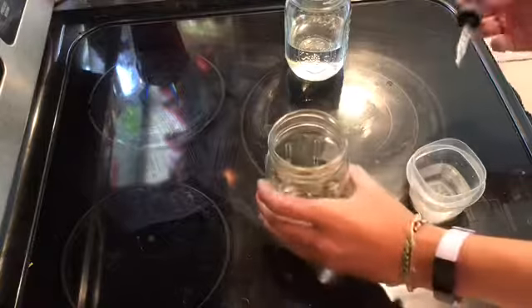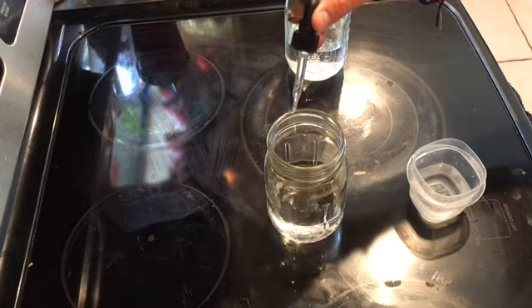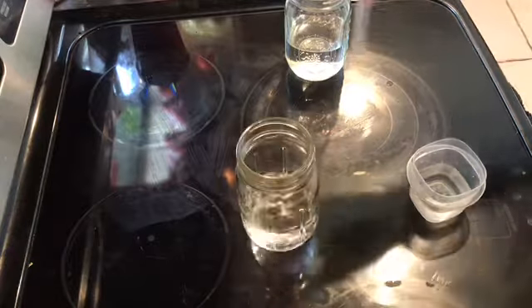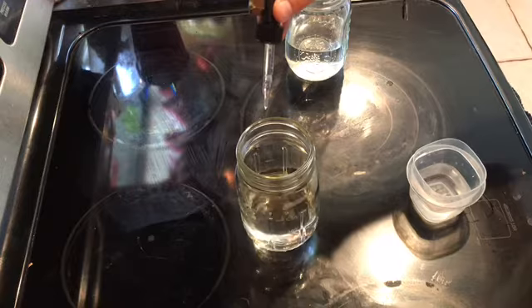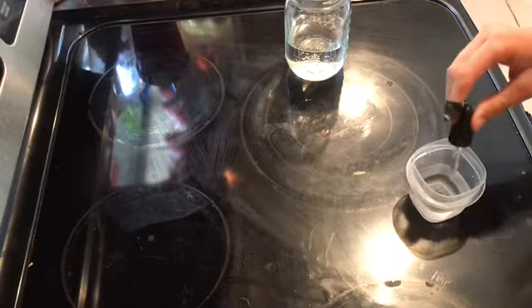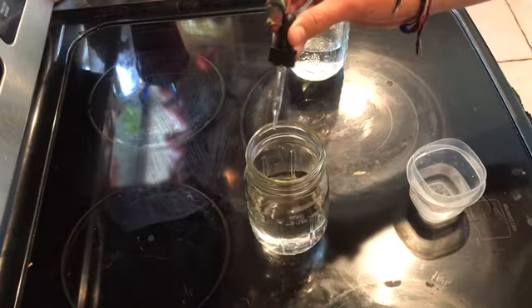The initial pH of the water was 7, and then there was a drastic increase in the pH after adding 10 drops of NaOH, and it reached up to 12.70, and then after 20 drops it was 12.50, after 30 drops it was 12.30, and after 40 drops, it was 12.10.